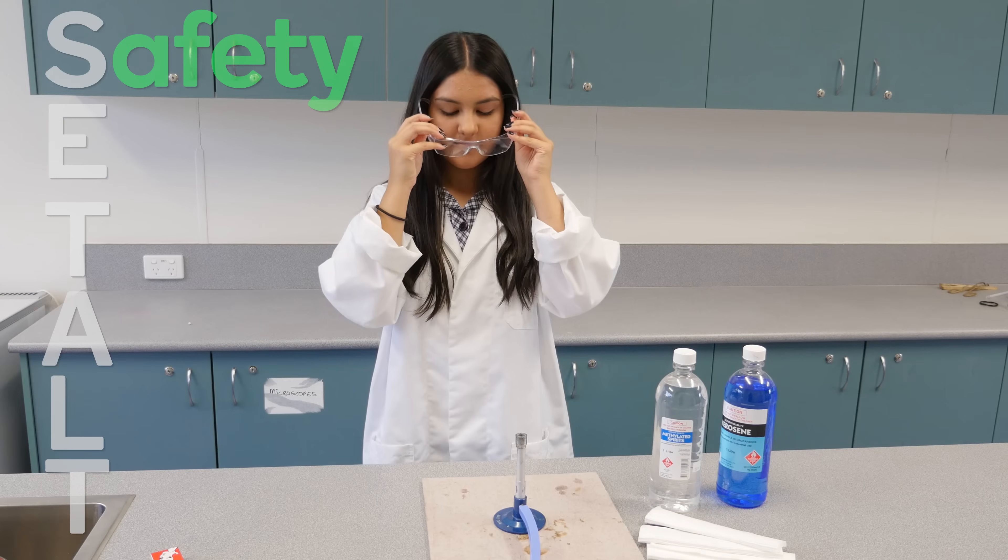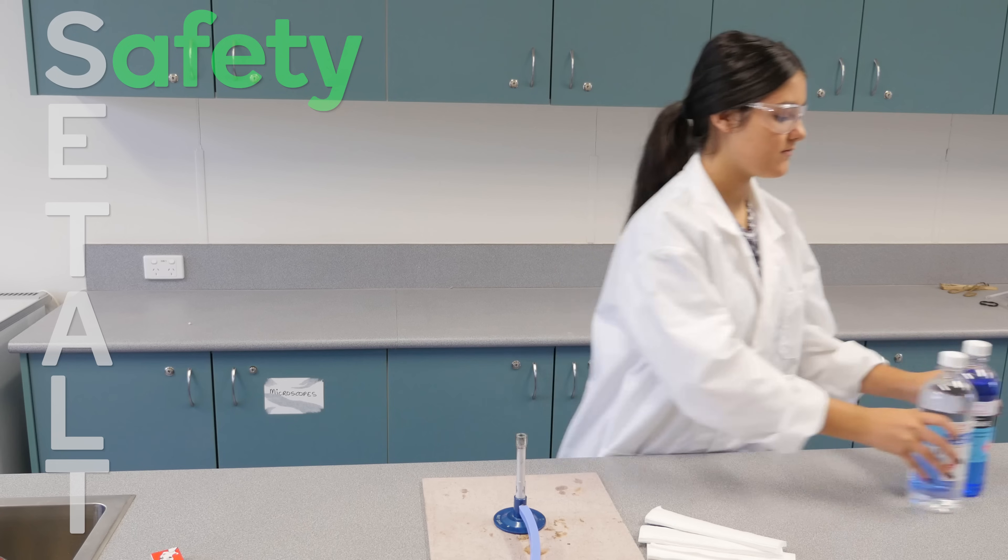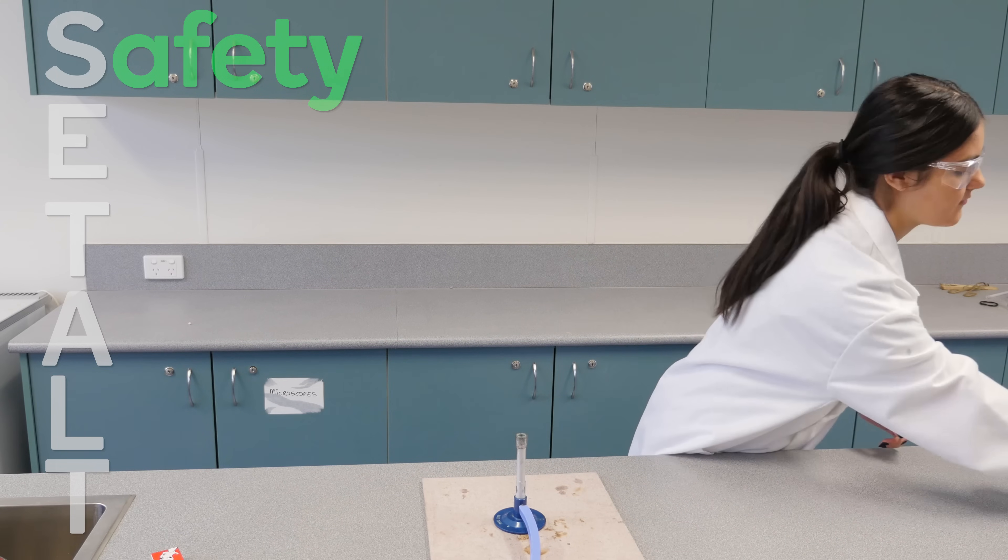S is for safety, which always comes first. Make sure you're wearing a lab coat and safety glasses. Tie back long hair and clear your bench of anything that's flammable, meaning that it could catch on fire.